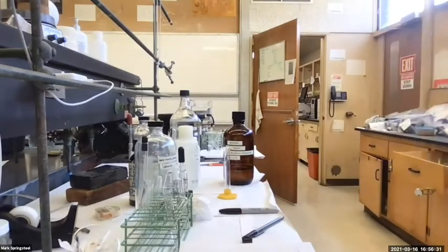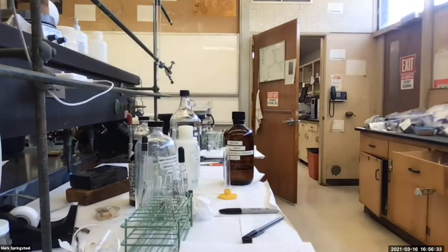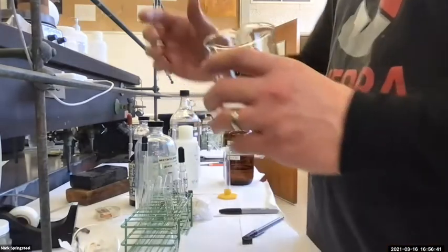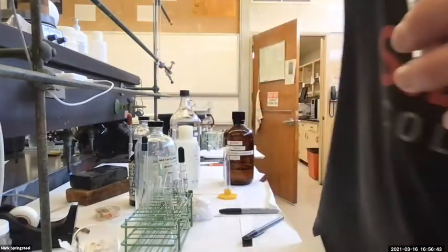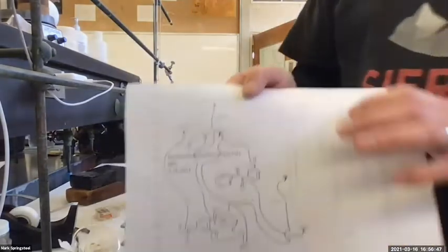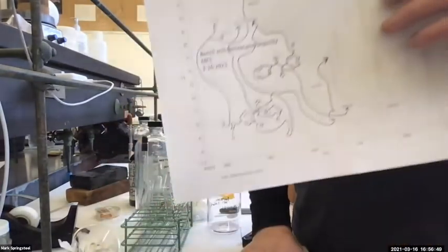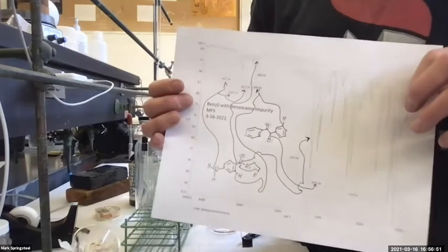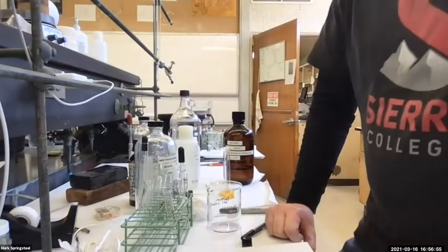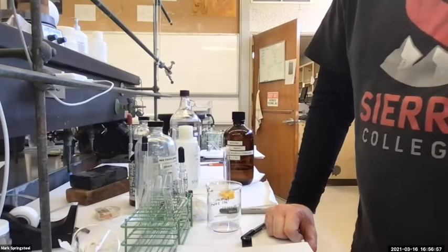And see how the benzocaine evaporation is going. Still got a little ways to go. I think I'm going to go hit it with the Conair 1875, but this will take a little while. What I'll do is I'll add this information and other stuff to the final video so you guys can check that out. And then the other extraction, the one with the unknowns, I'll do that at another time.